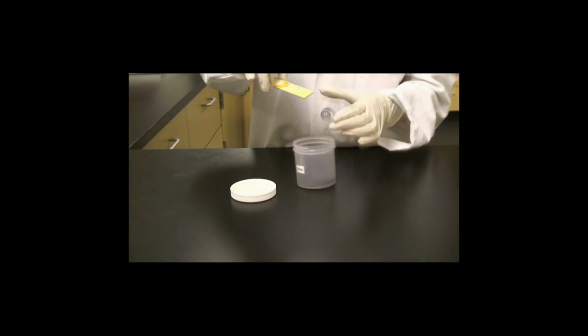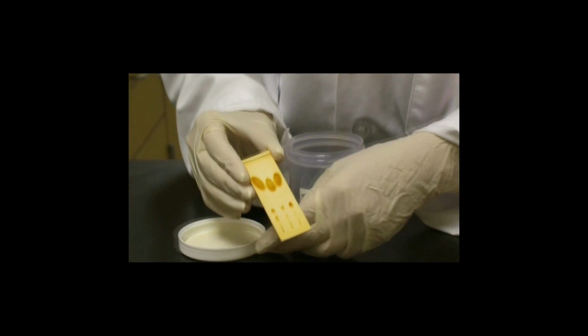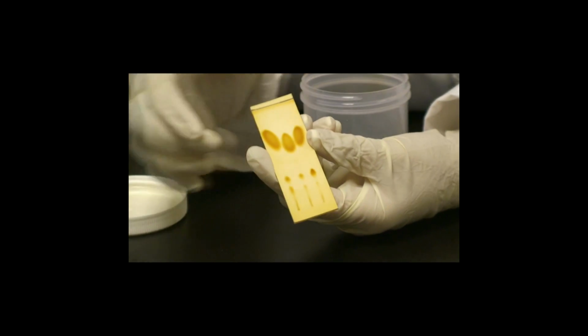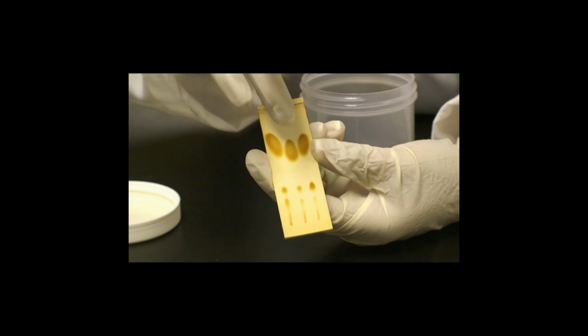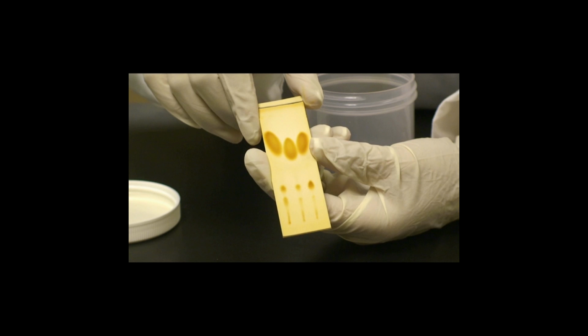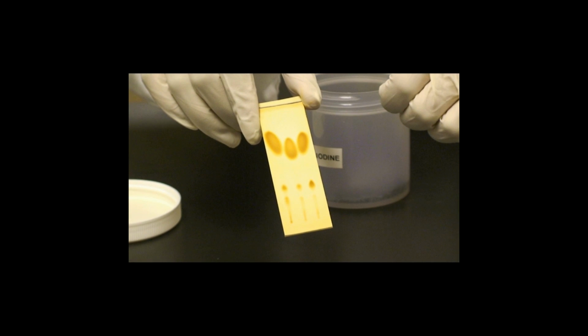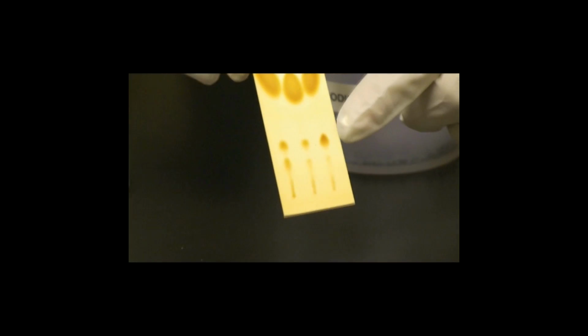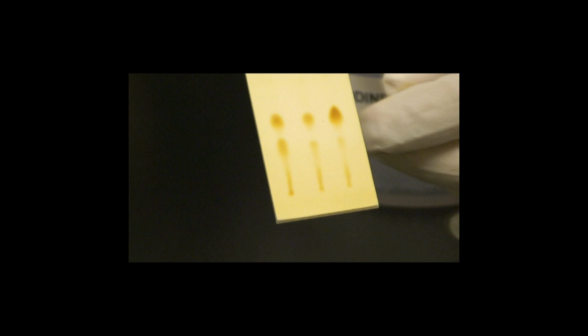The two most important spots to read on the TLC plate are the top spots, which are the jojoba wax esters, and the ones which are second from the top, the triglycerides. The wax esters spot is important for identifying jojoba, since jojoba is the only plant which generates liquid wax esters in its seeds. The spot located second from the top is the triglyceride spot. The intensity of this spot identifies possible contamination.